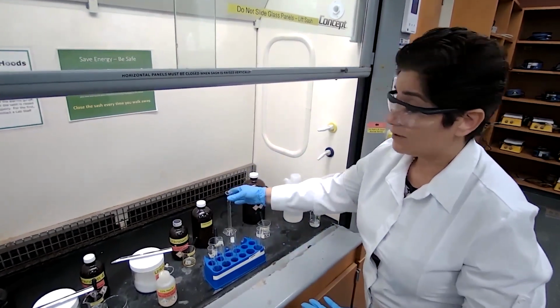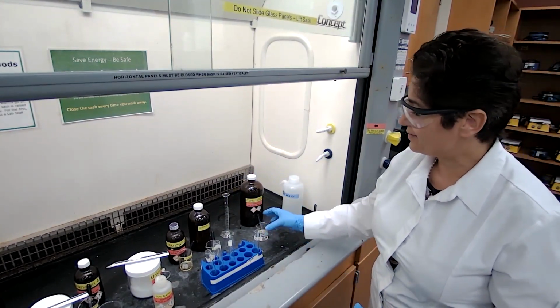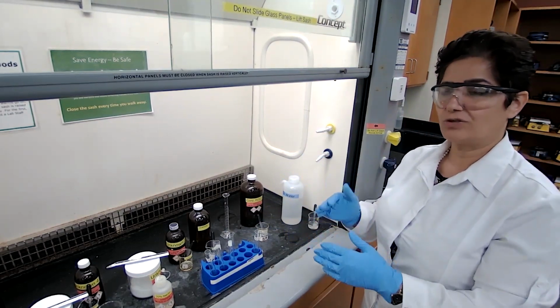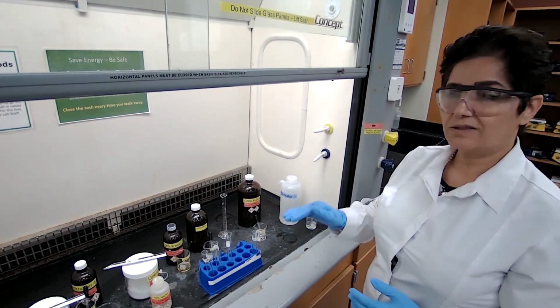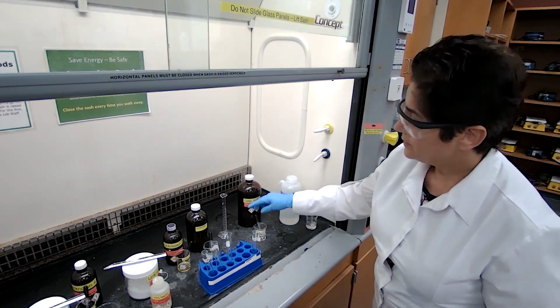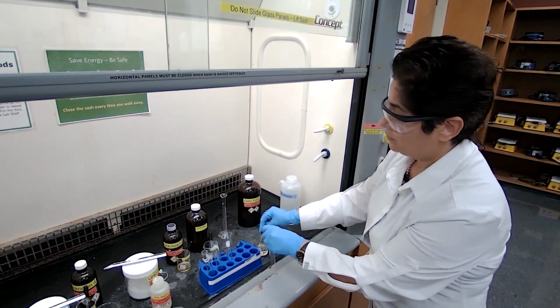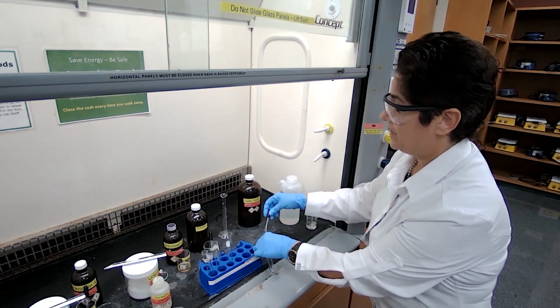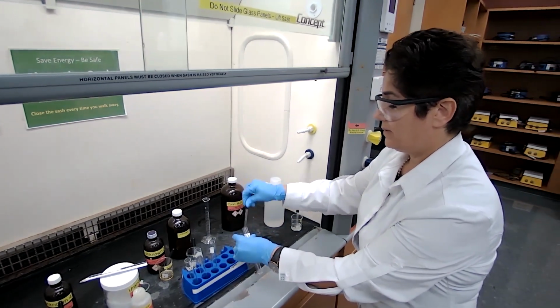So for safety and saving time, it's better to use this approximation as long as you keep the ratio of solvent to solute the same and consistent and proper. You don't want to saturate your solution. So we are adding 2 full droppers of the sulfuric acid to unknown 1. A color change can indicate a reaction here as well.